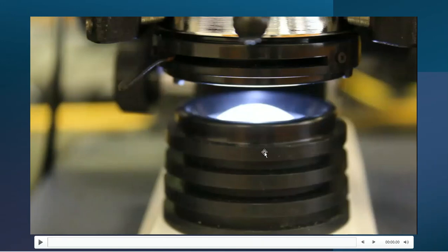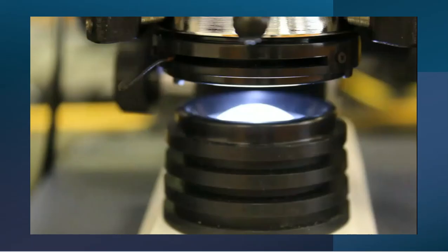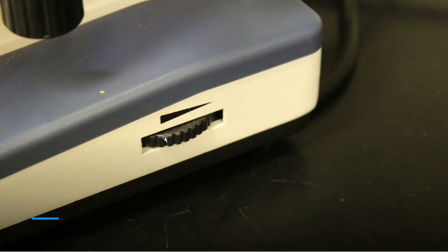And there is a way that we can darken this or bring more light onto the slide for the viewfinder and for the computer software. So I'm going to walk you through that process here in just a bit. But to actually turn the bulb super bright or super dim, it's always going to be better to do that here on this microscope off to the side.